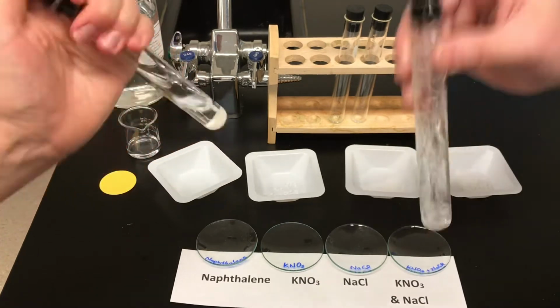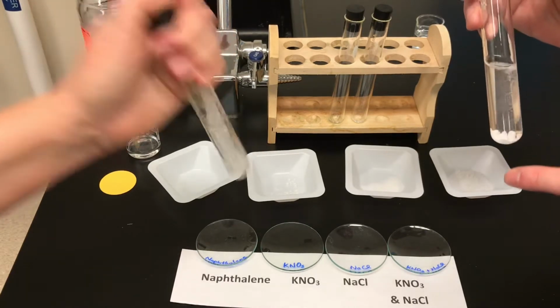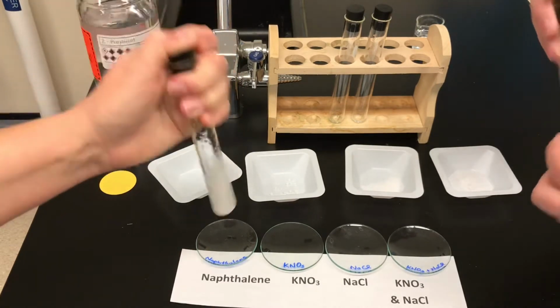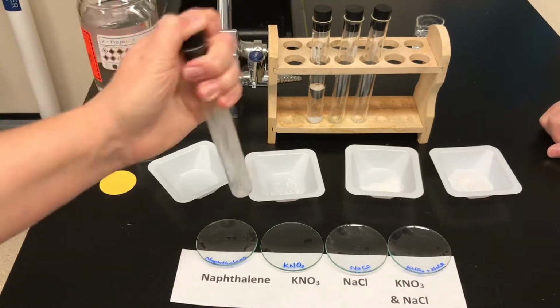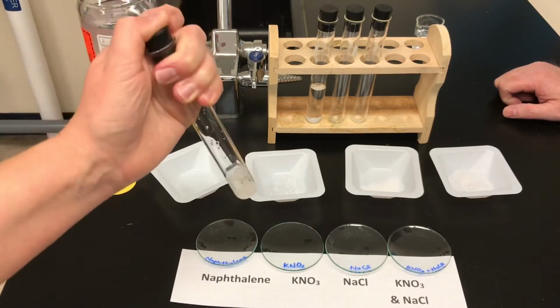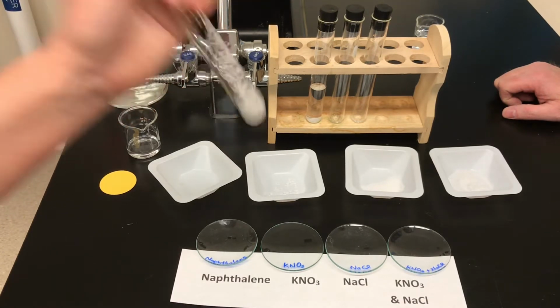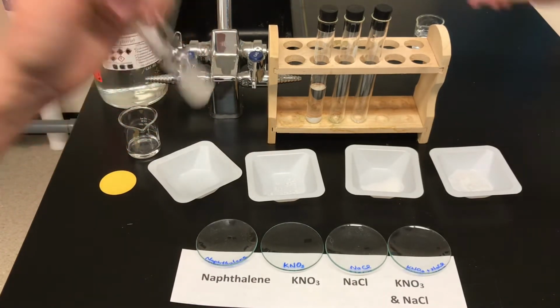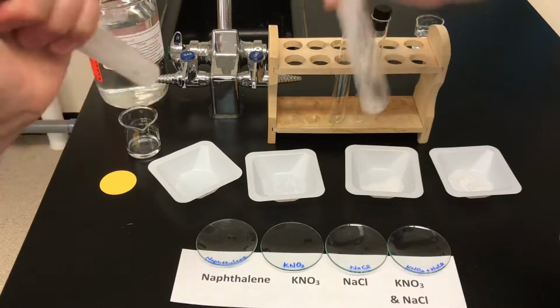Now one thing I'm noticing is as I dissolve my potassium nitrate, the solution's feeling cold. So as it feels cold, this dissolving must be an endothermic process. We don't have to dissolve everything, we just want to dissolve some salt. In fact, we don't want the concentration to be too high, do we, Ms. Watts? We don't want the concentration to be too high, or the outcome of this experiment won't be what we're hoping for. We don't want to have a really highly concentrated salt left over or solute left over on our watch glasses at the end. We want to be able to see hopefully individual crystals form rather than a clump of solute. That's right. So you want a relatively low concentration. So if there's some salt that isn't fully dissolved, that will be okay.